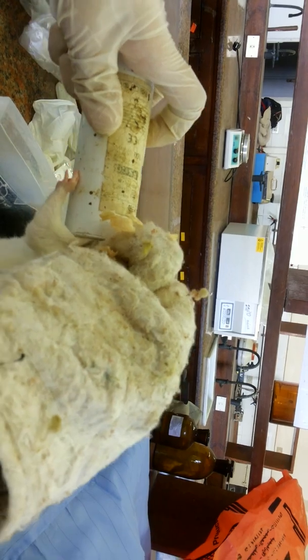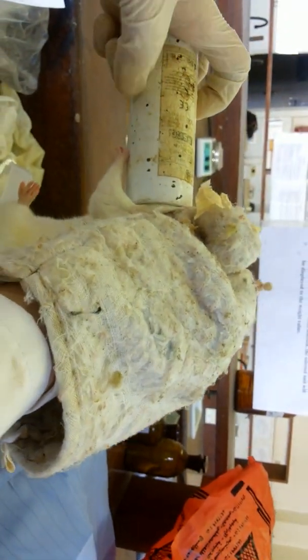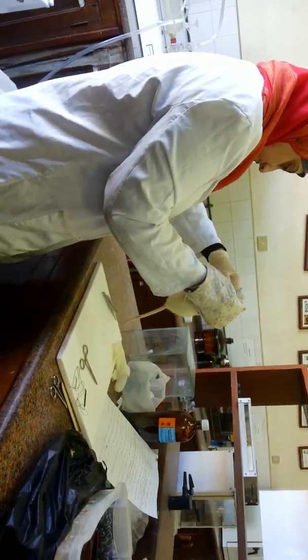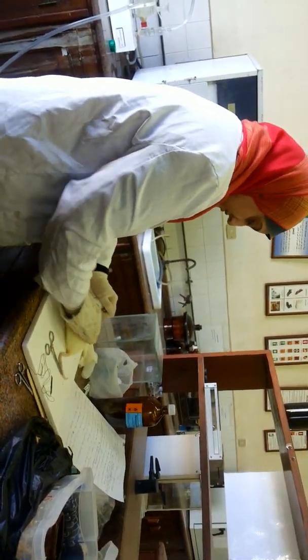She is strong. We need to ensure that she is fully anesthetized or has lost consciousness by checking her tail — as long as her tail is not limp, she is still aware and not yet fully unconscious.